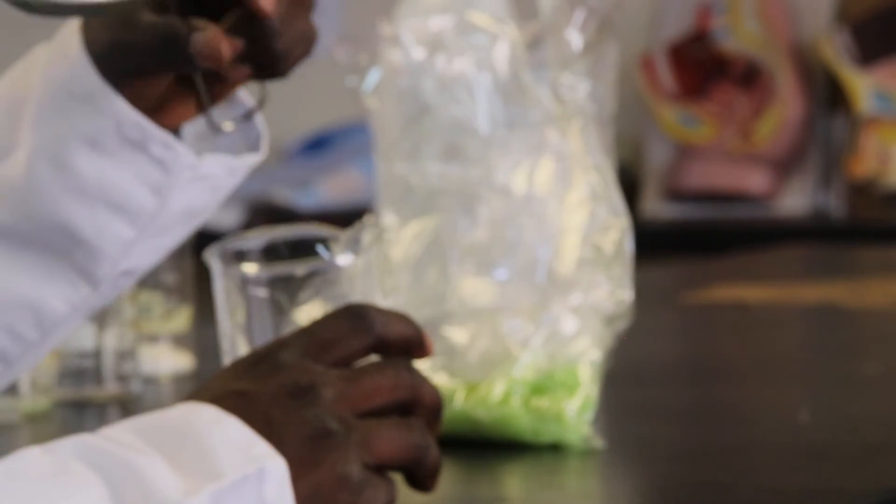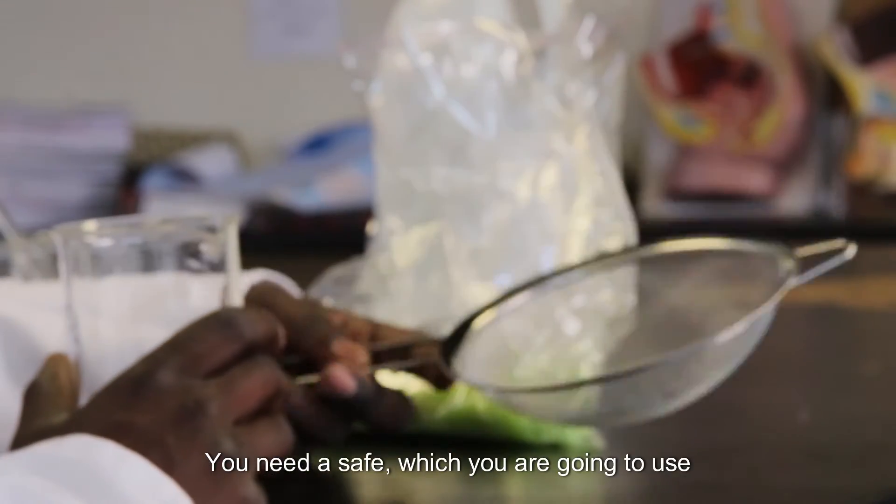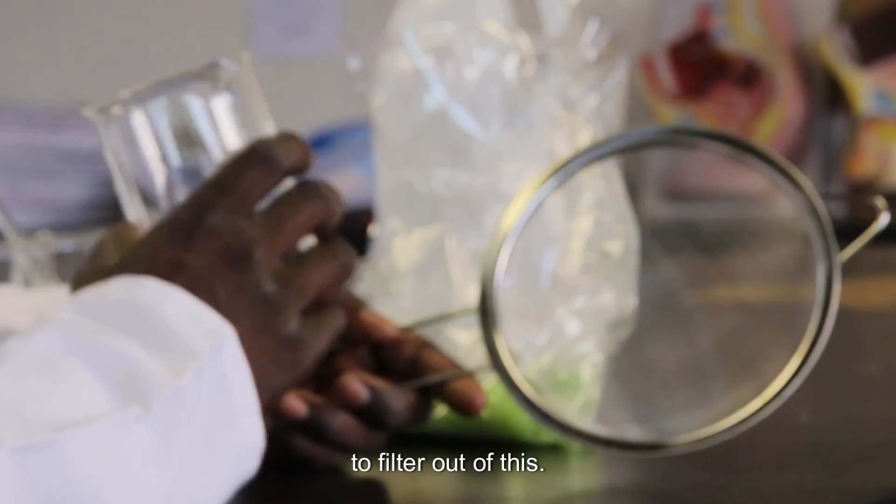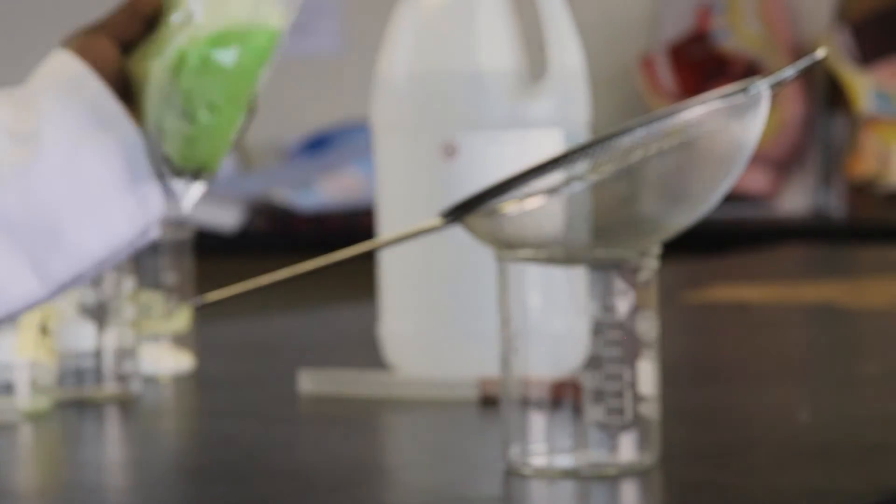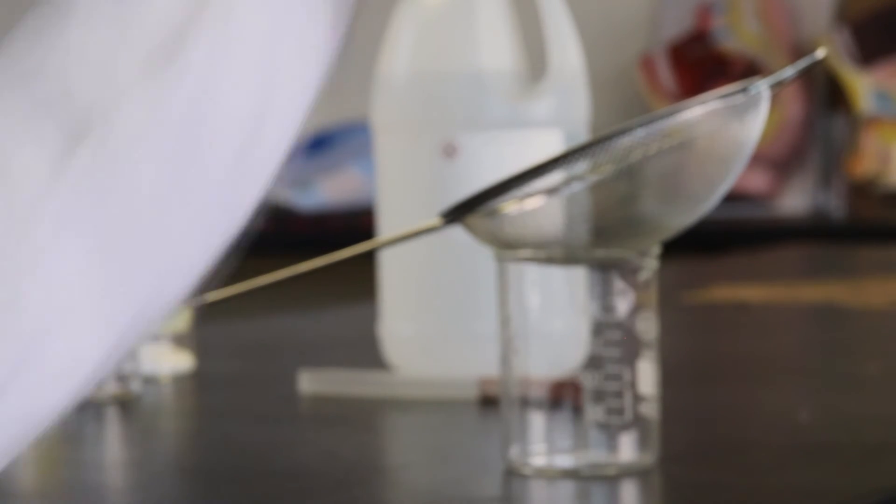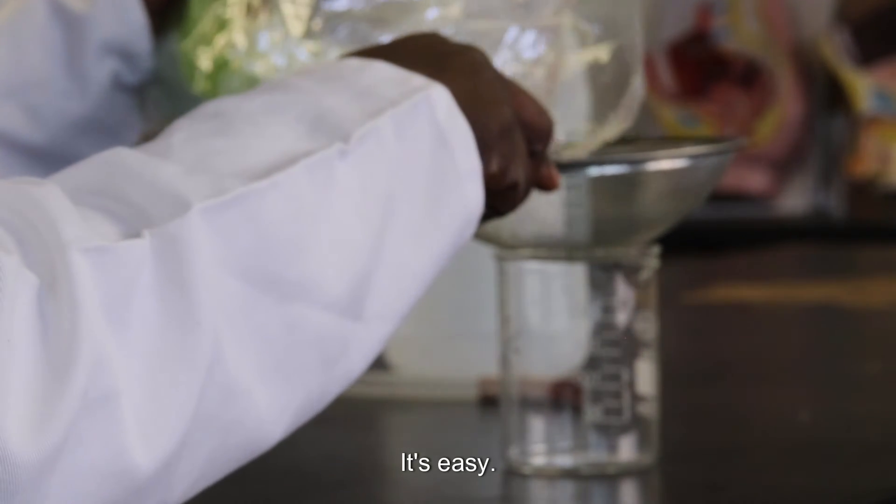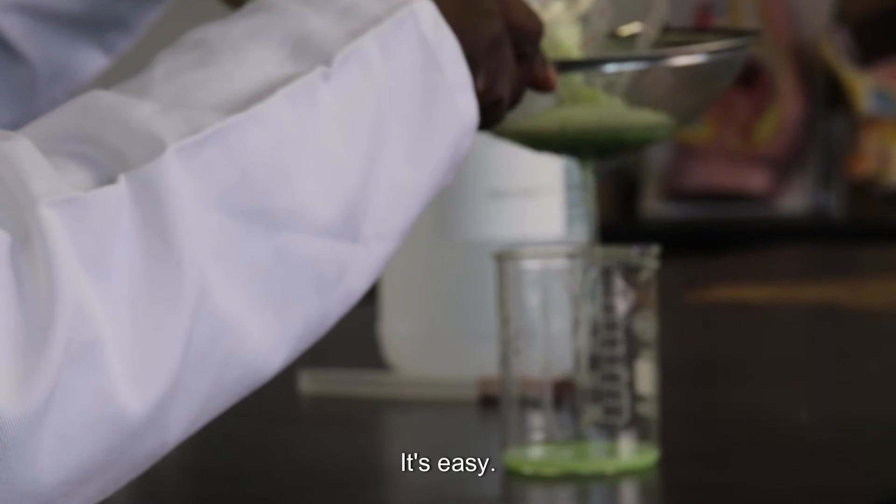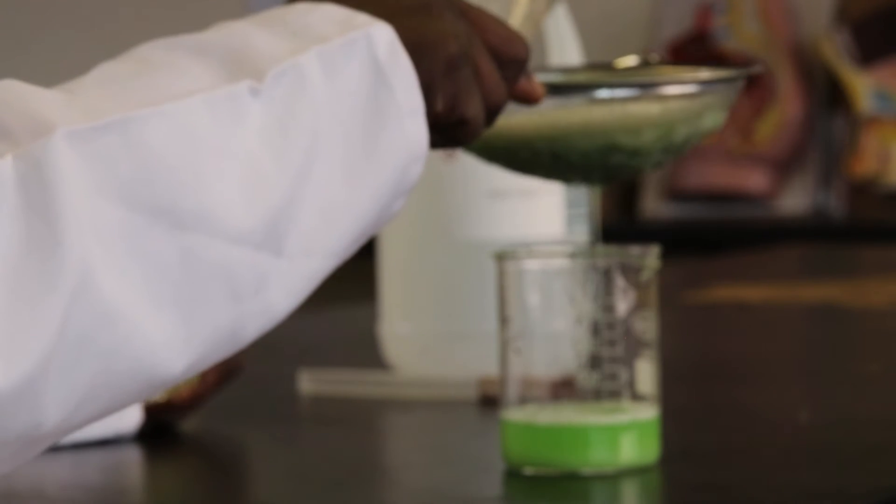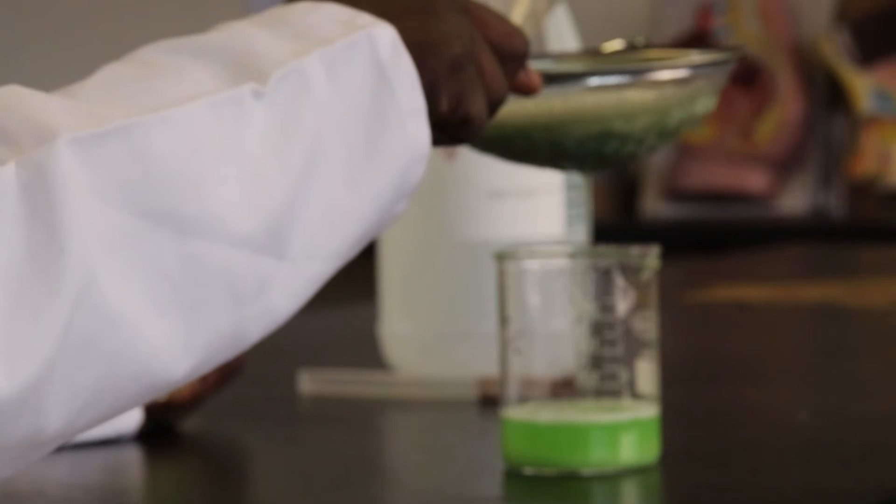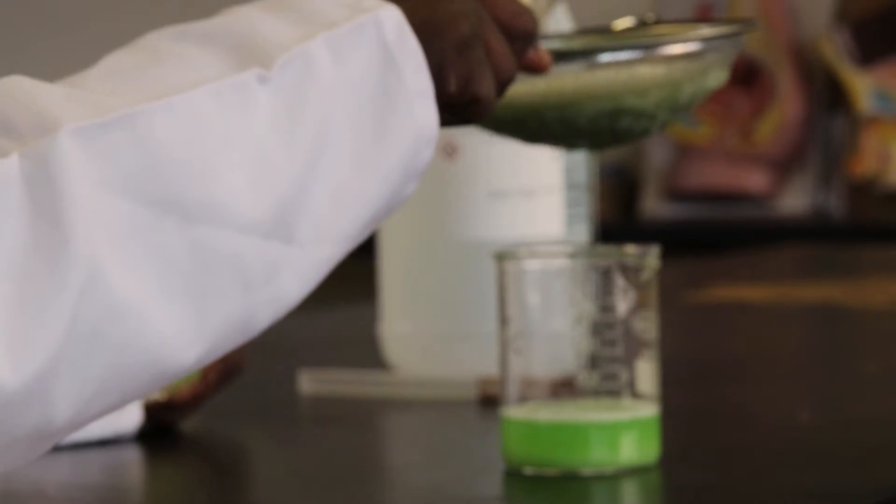So you need a sieve. You need a sieve which you are going to use to filter out this. So let's go to filter it out. So now let's go to the fridge.